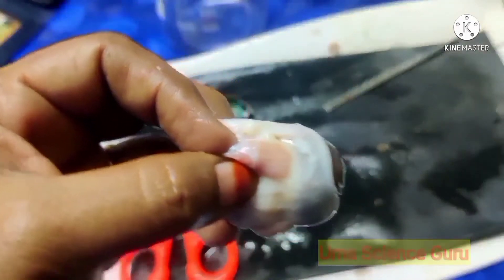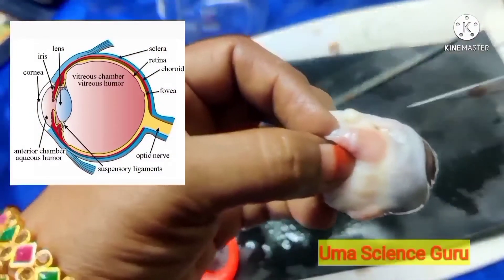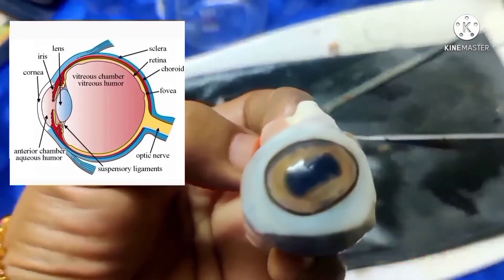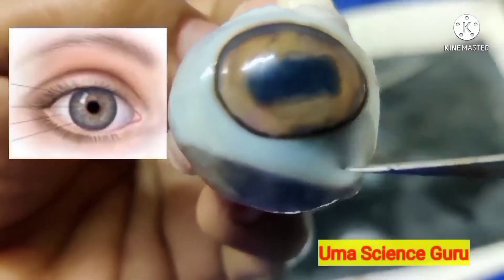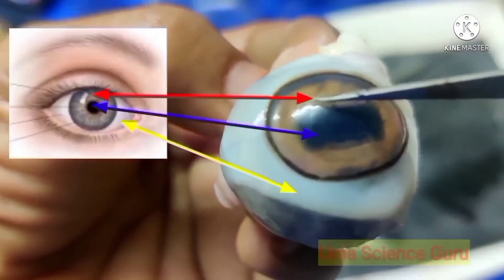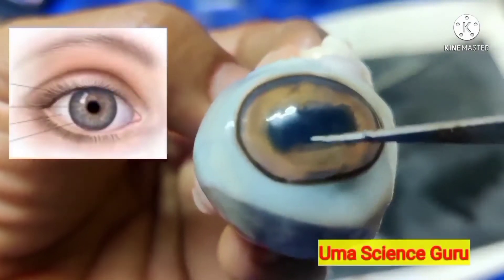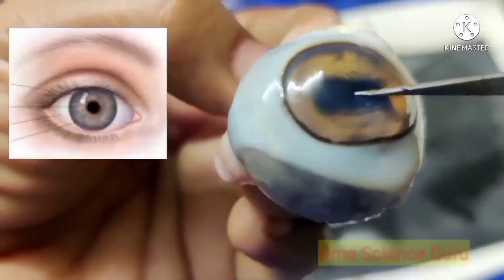In certain emotional states such as laughing and crying, this fluid flows in excess — what we call tears. Students, let us dissect the eye. The eye is the organ which gives the sense of sight and also acts as a window to the outside world. Observe the external parts: the sclera and the pupil. The pupil is rectangular in shape in the goat, whereas it is round in humans.